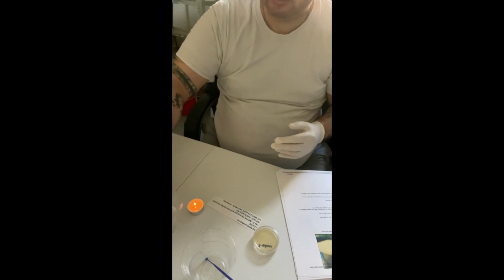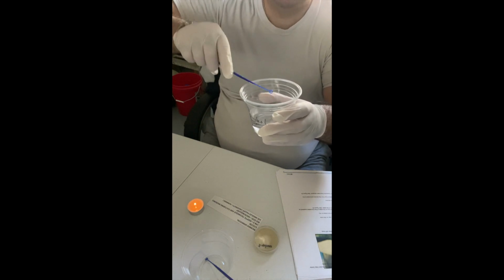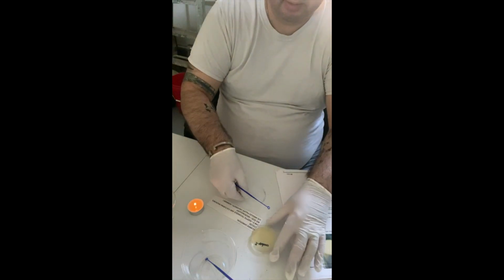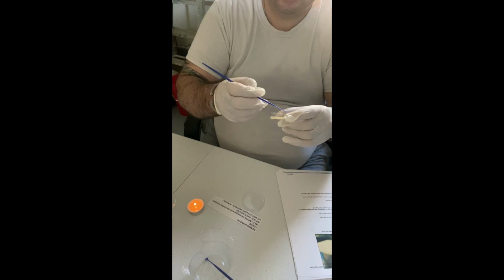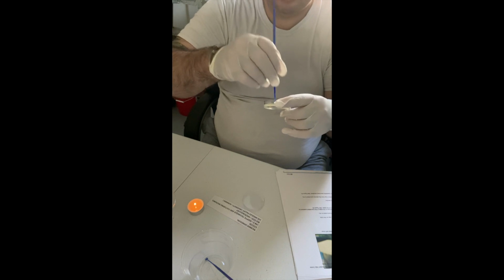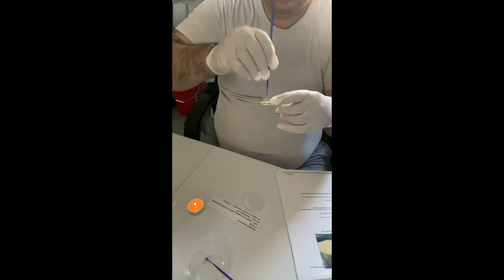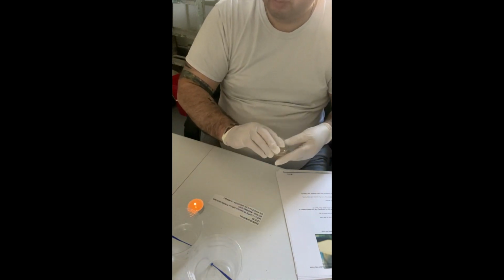Okay, it's been about 20 seconds. So I'm going to give it a tap here. Open my lid here, attach it to the edge of the corner of quadrant 2, both sides here, and go into quadrant 3, zigzag motion on both sides. Okay, this goes back into the alcohol. Lid on, and we'll give it another 20 seconds.